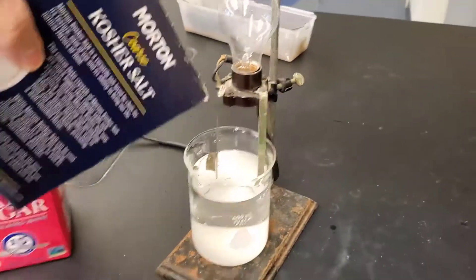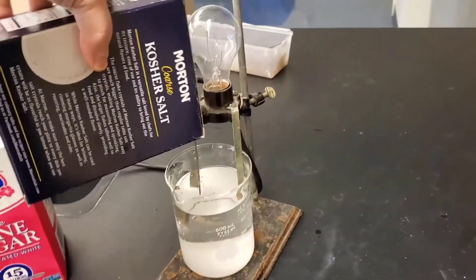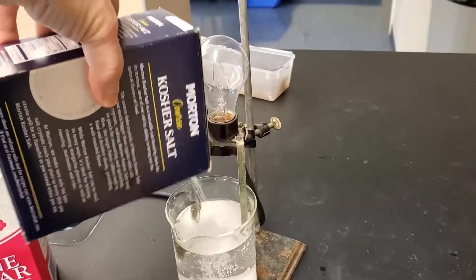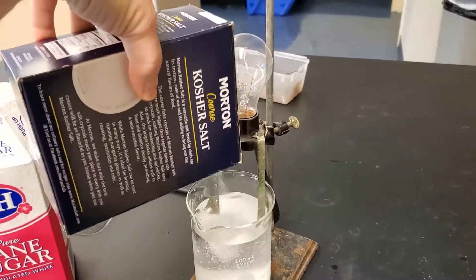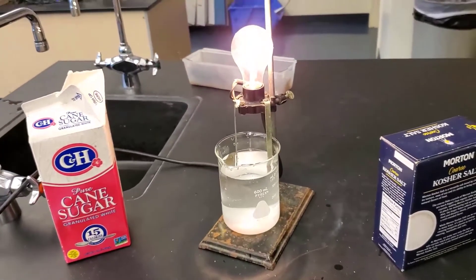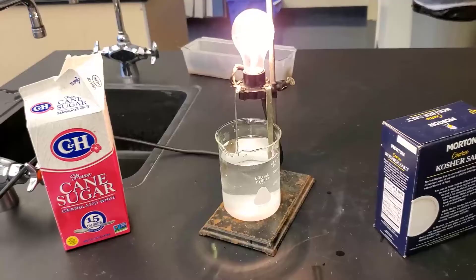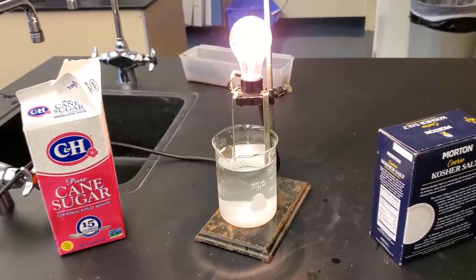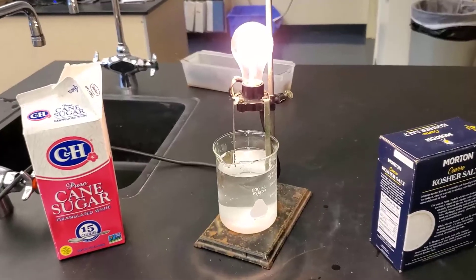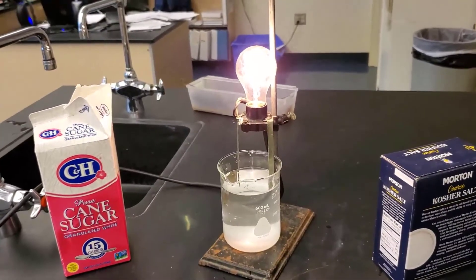Just to show you it's not a trick, let's take our salt and add it, and once enough ions have dissolved, there you go. A really cool mystery we can solve — I can give you a bunch of different powders and say which of these are ionic compounds and which are not. If it conducts electricity, they are ionic compounds.